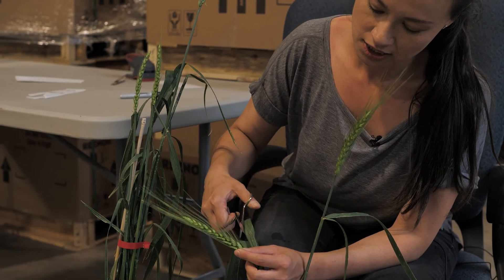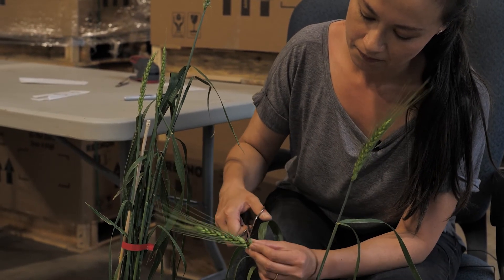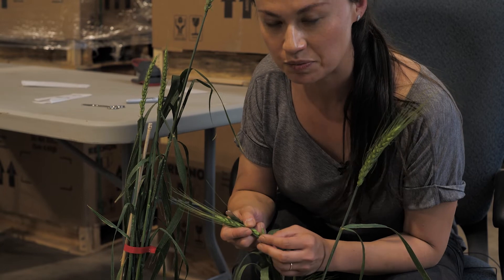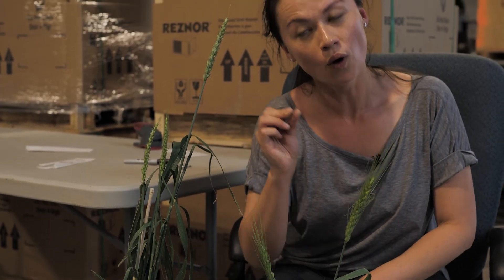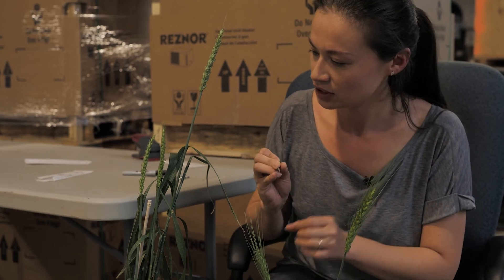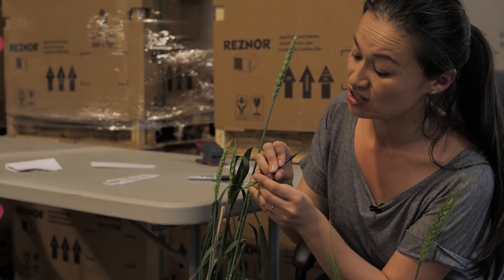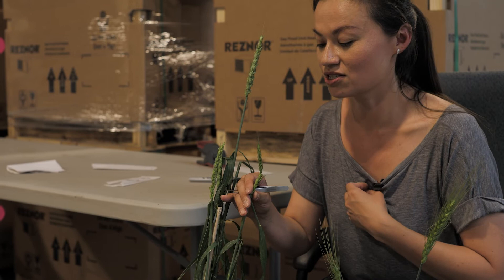To collect pollen, give the male head a haircut at angles to open it up, and wait for some of those anthers to come out. You want them nice and plump and yellow. Once you have an anther with pollen, just go over into that pistil and touch it — that's all you do: one, two. Usually you can use that one anther for most of the head. I personally like to use two or three just to make sure I've got some pollen on there.